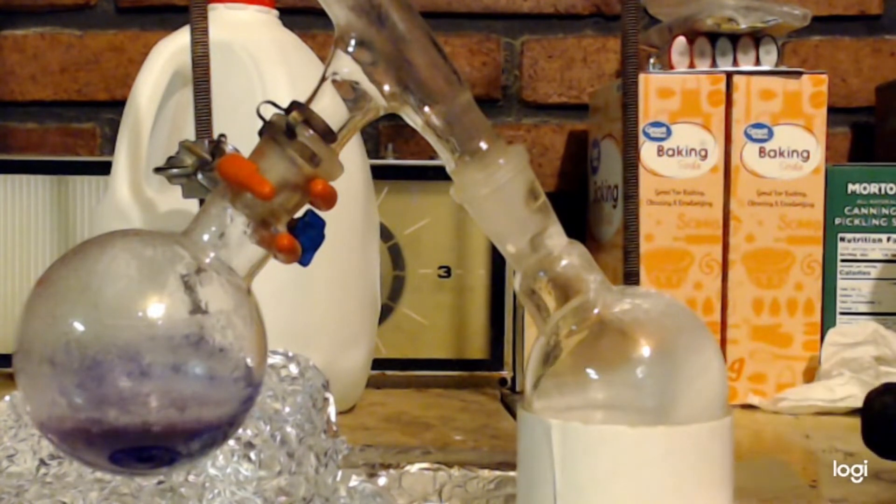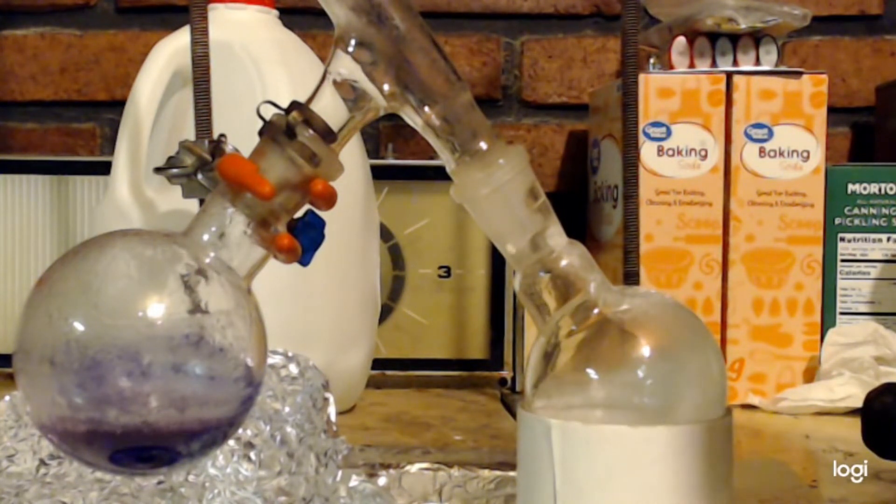Keep in mind, this isn't formaldehyde. It's the acetal of formaldehyde. So it can easily be changed into formaldehyde just with some protons and water, heat it up a little, and boom, you have formaldehyde. Although if you add water, it'll be formaldehyde dissolved in water. And these crystals are beautiful. I wish I could show them on camera. You can't really see very good with my cheap camera. But they are beautiful crystals.